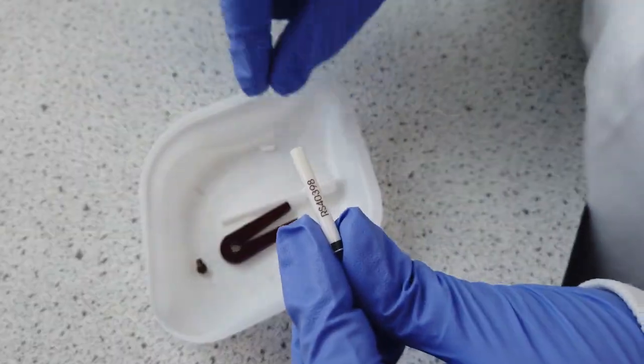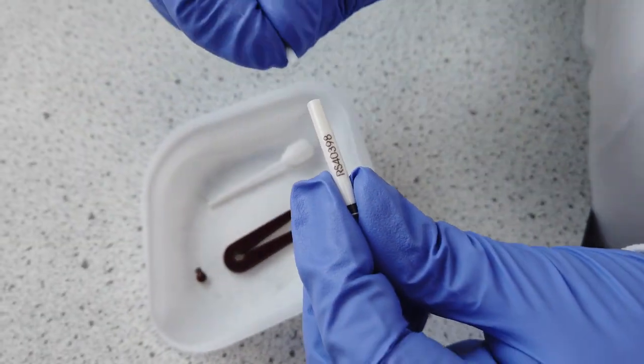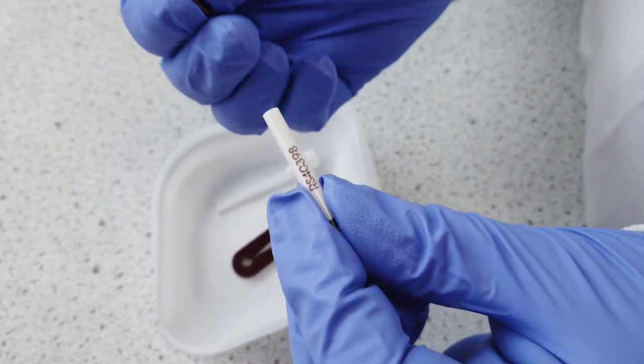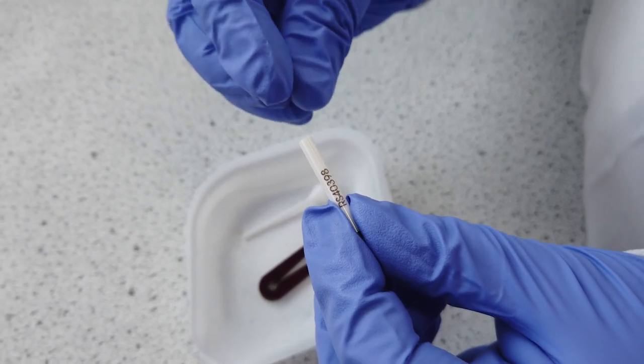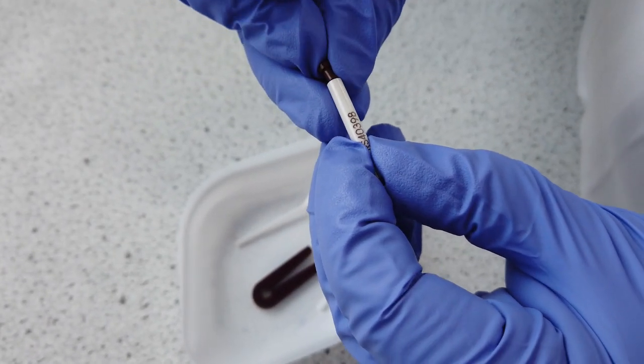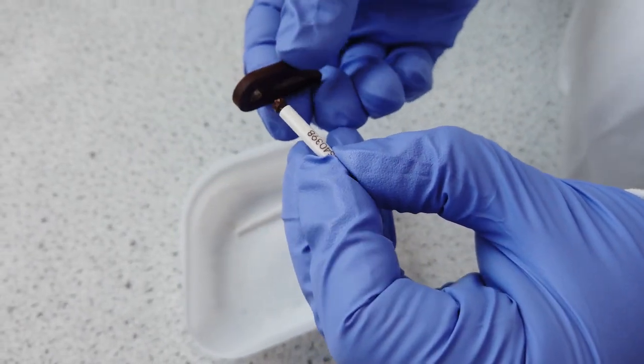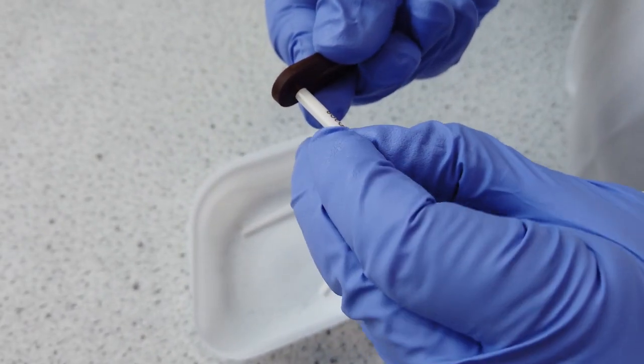To start assembling, insert the bottom spacer into the rotor sleeve. Insert the brown tip into the sleeve by rotating it with the aid of an opening tool until you can no longer see light passing through between the tip and the sleeve.